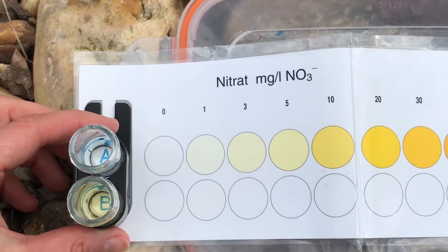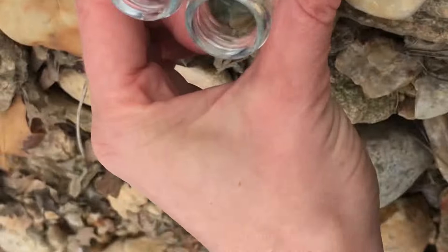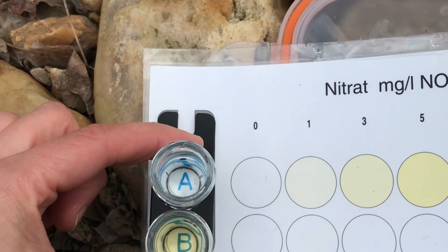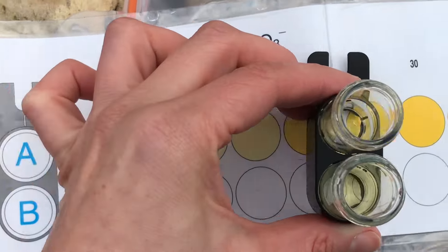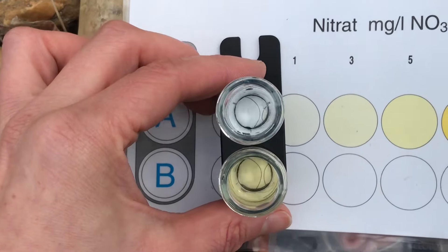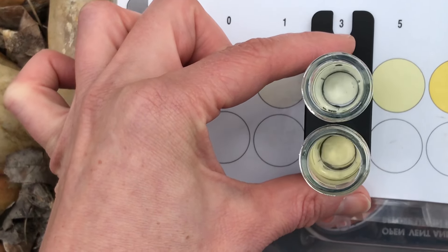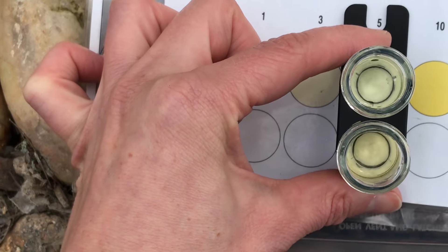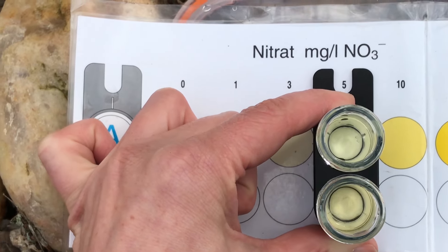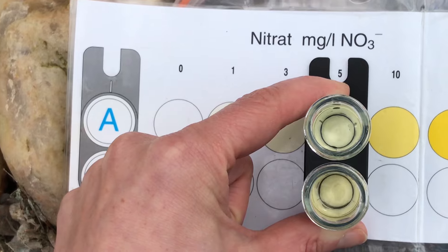We've come to the final step in our nitrate test. Test tube B has had chemicals added to it, which react with the nitrate to turn the water a shade of yellow. I need to figure out which number on the color comparator most closely corresponds to the color that test tube B has turned. It's definitely darker than 0, not 1, might be close to 3 — and our closest match today is actually 5. That's not our final result though; we have to convert that reading to the concentration of nitrate in the water, which will be in milligrams per liter.